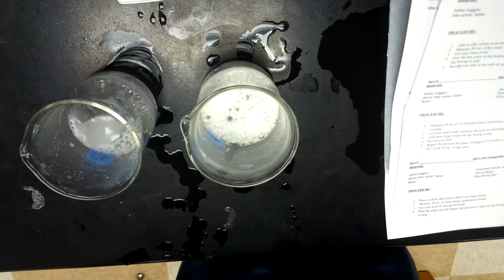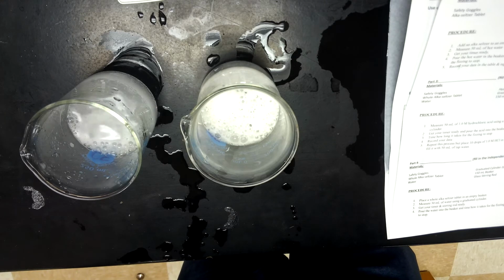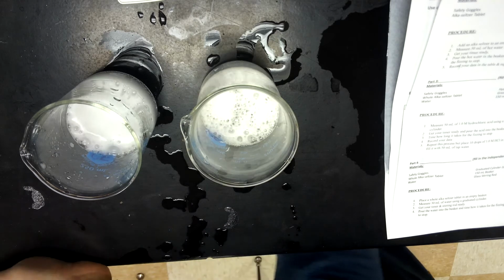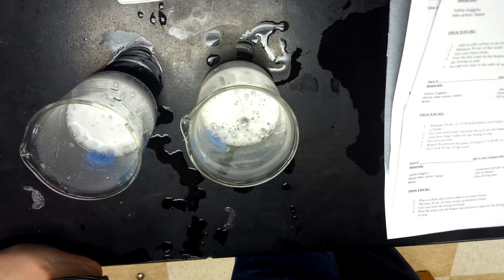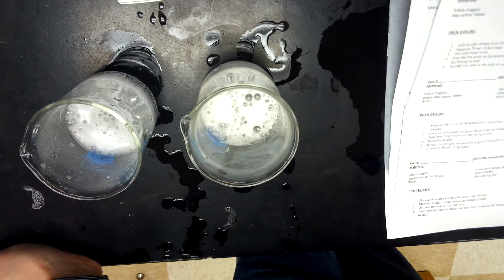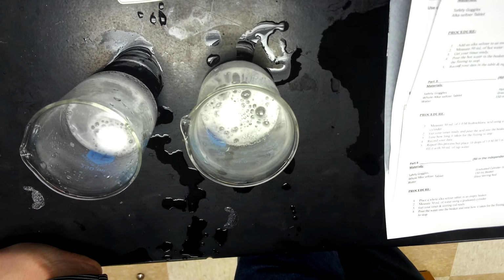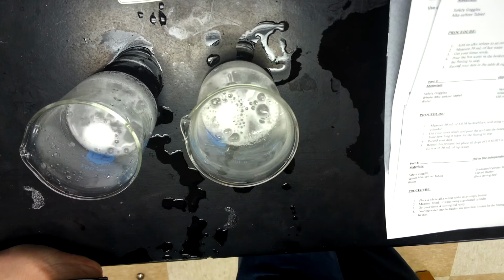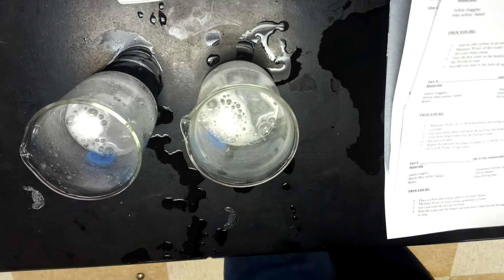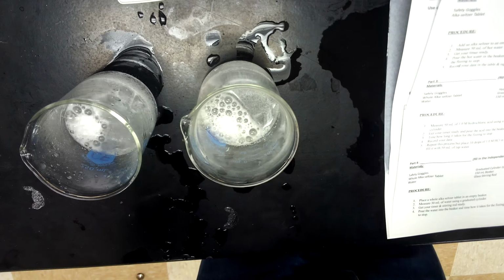So this one's kind of interesting. This one surprises students a lot as well. So as we pay attention to these, we can see effervescence happening. We can see some awesomeness happening. But you really would think that acid would go super, super fast compared to the normal. Well, it turns out that effervescent tablets actually like to interact with water. They actually want more water. They're more likely to interact with the water. In fact, hydrochloric acid is still mostly water at these concentrations, and that's what it's reacting with.